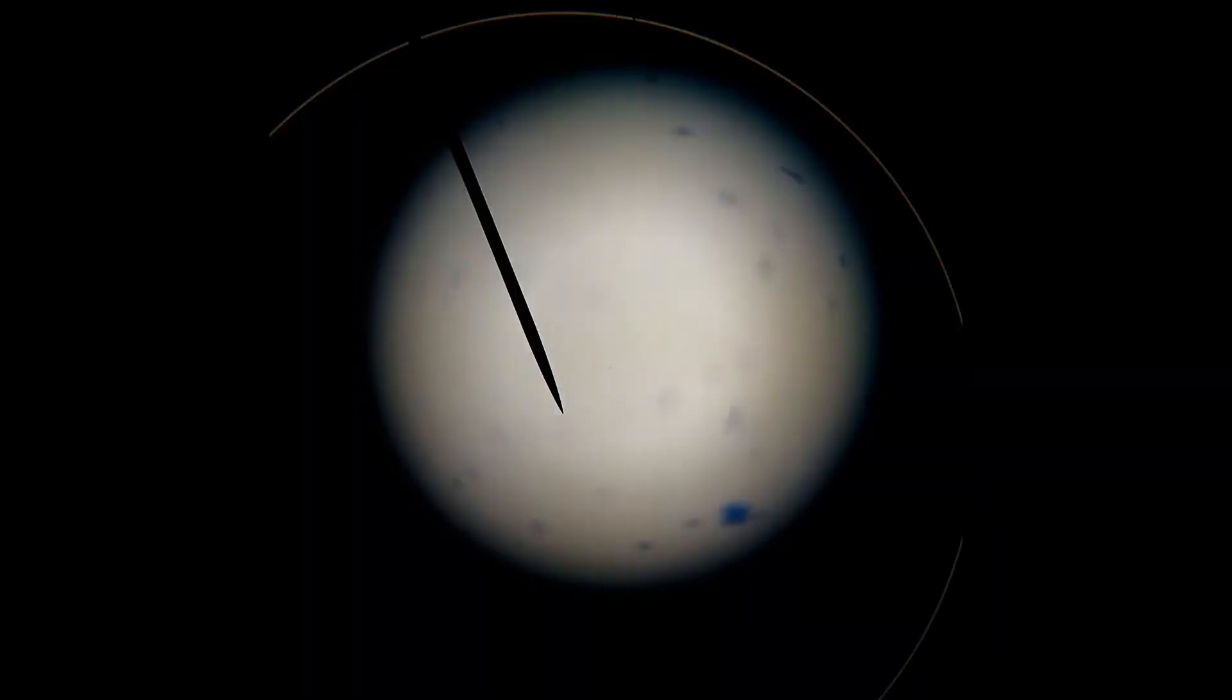So as you can see I'm now on the lowest power objective lens with the stage at its highest possible location. This will then allow me to see the greatest field of view because it is the lowest magnification so I have the widest field of view. I can then zoom in once I notice where all my cells are located.